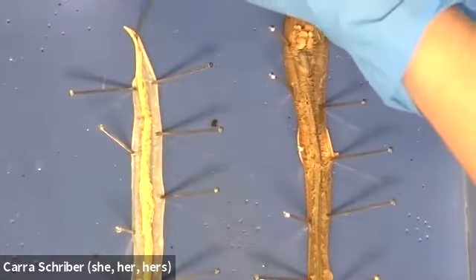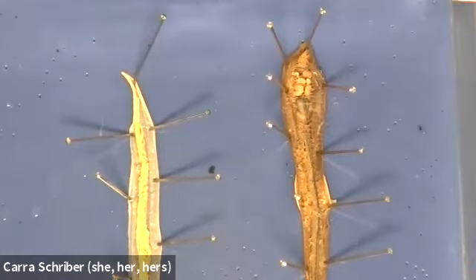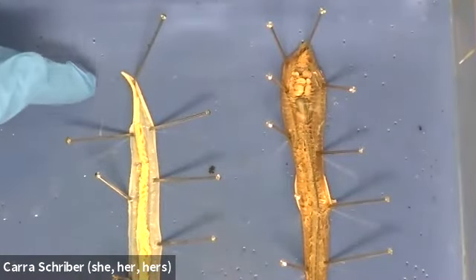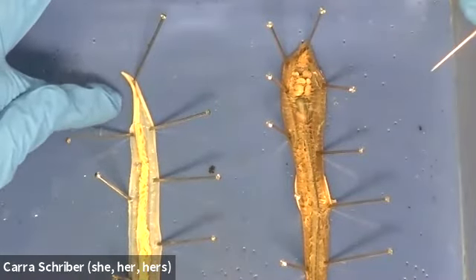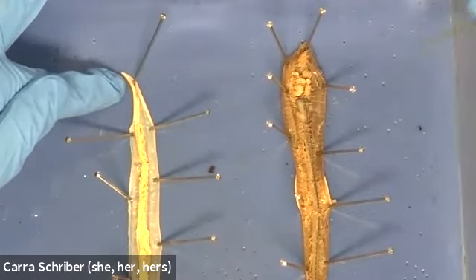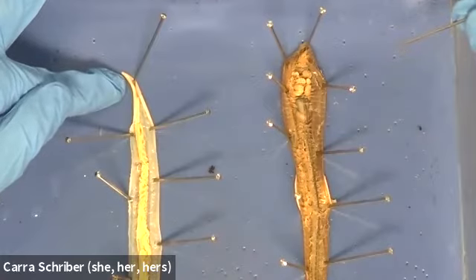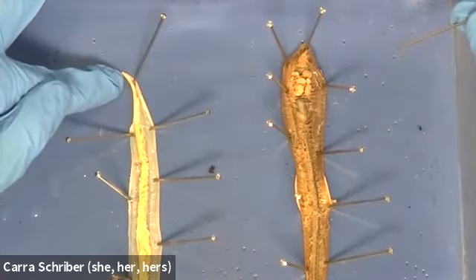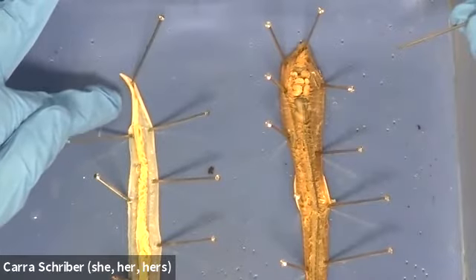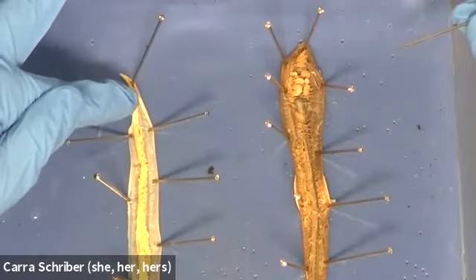And let's start with our roundworm. Here we have the tip, or the mouth. With roundworms, we have a very, very simplistic digestive system. It's composed of a mouth and an esophagus, or we're going to say esophagus or pharynx. It can be interchangeable here.